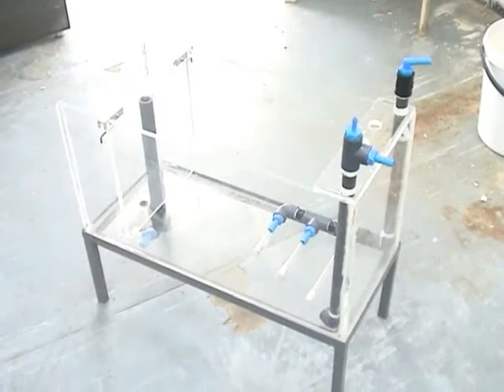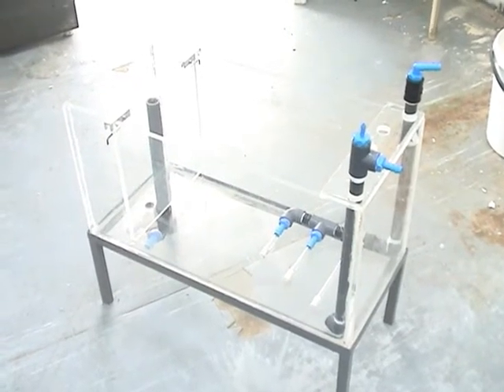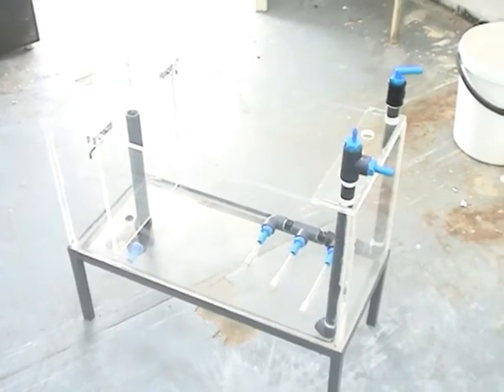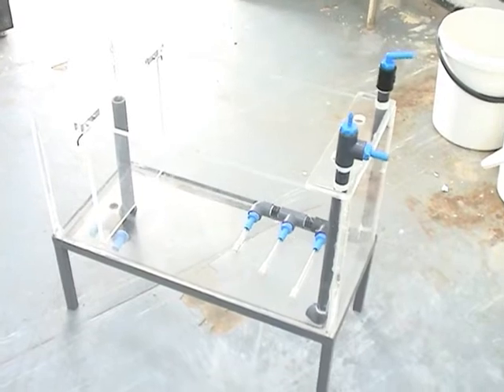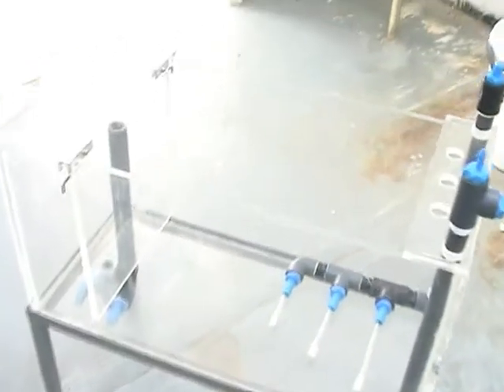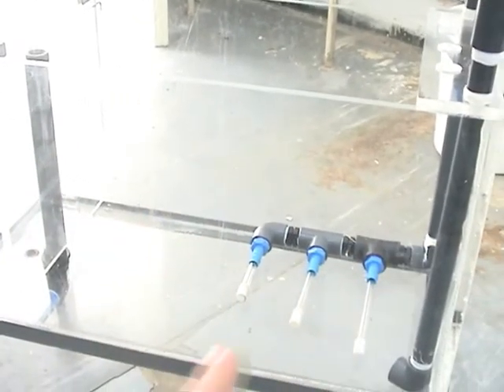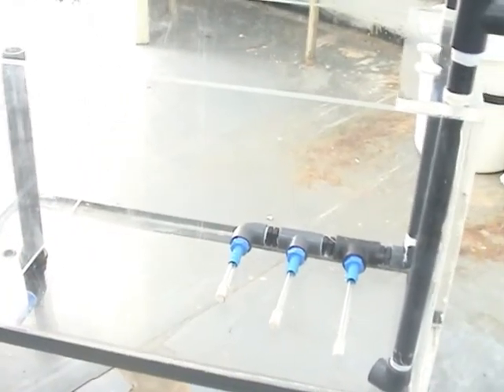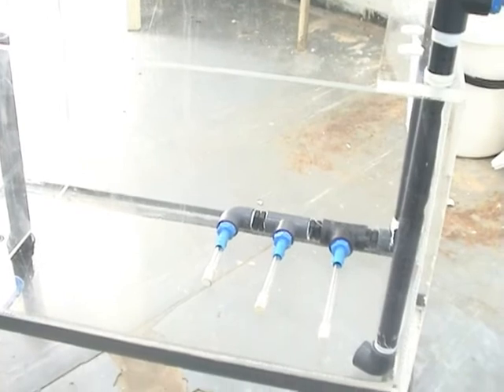You can see our laboratory reactor for struvite crystallization here. The reactor is the part where we have the complete mix and aeration.